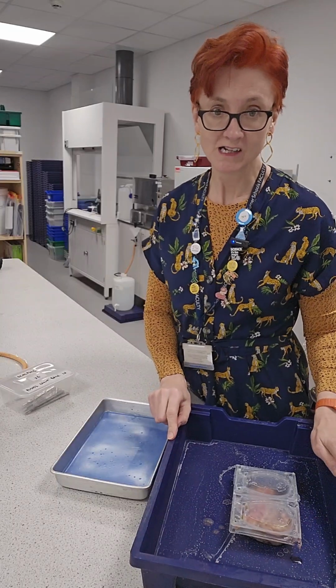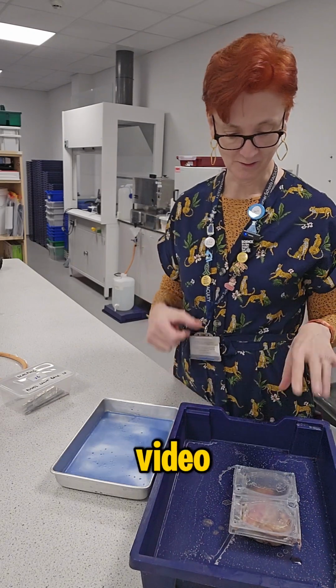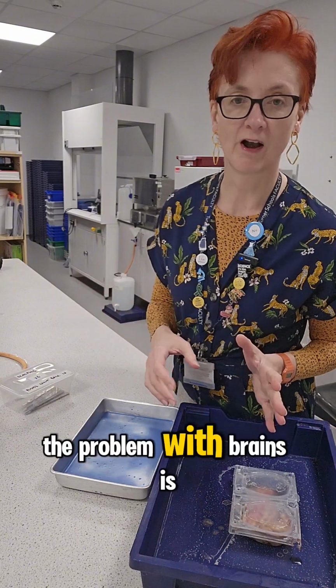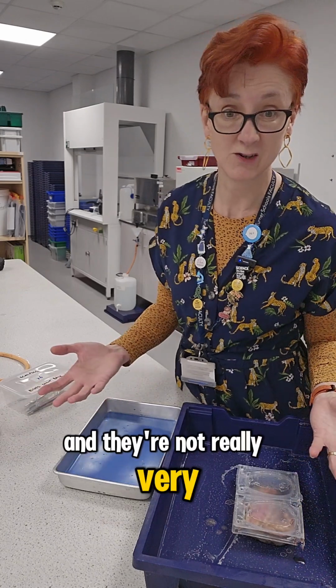School science technician. It's not all glamour. Sometimes it's brains. Again. Yes, this is the third brain video. If you weren't here, let me start from the beginning. The problem with brains is they're squishy. And you buy them frozen and then they defrost and then they're just mush and they're not really very useful.